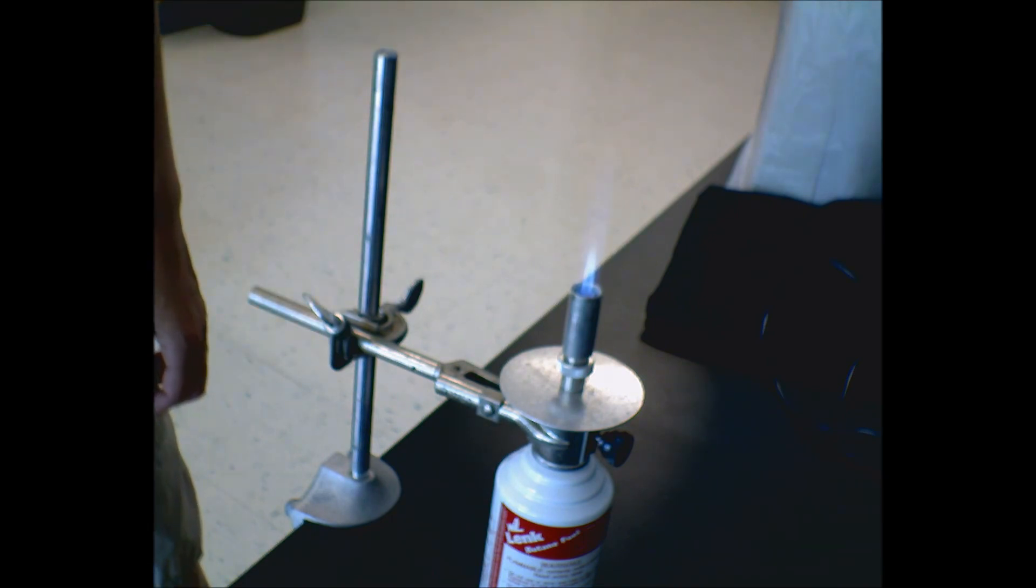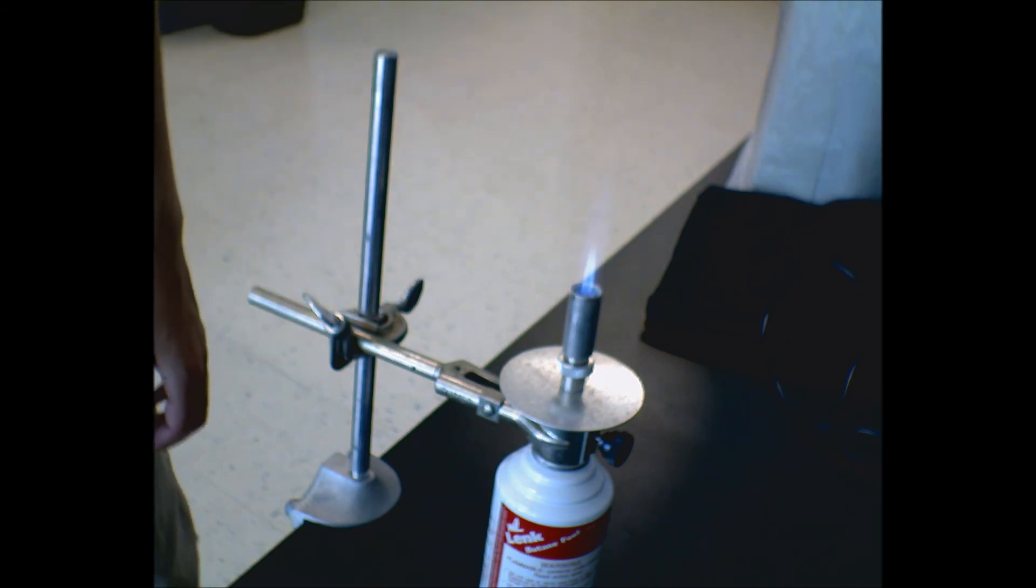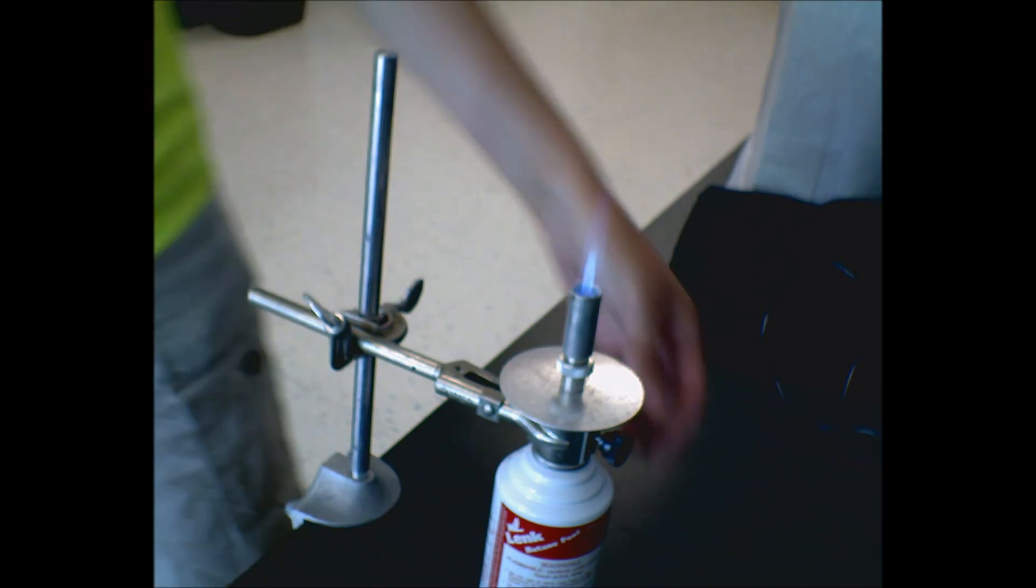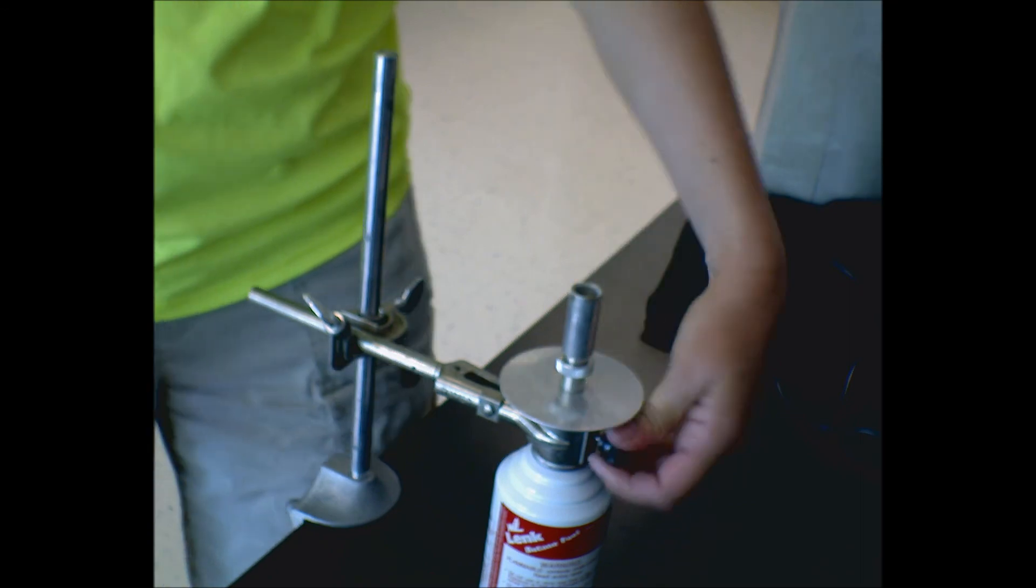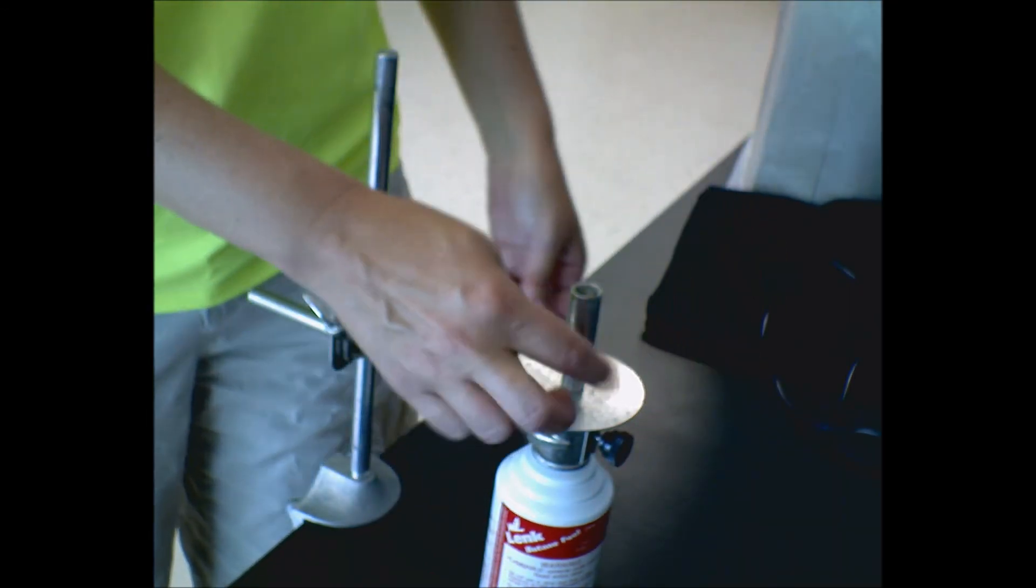That's how we're going to use our type of butane burners for heat. Again, turn it off, roll that up for the next person. It's always nice. And there you are.